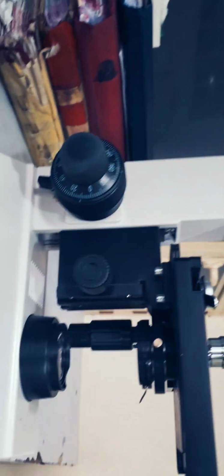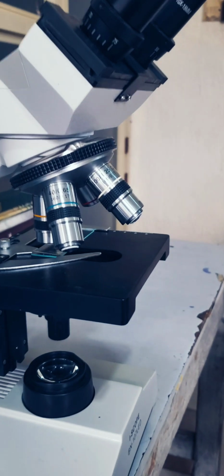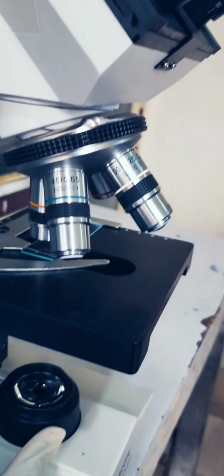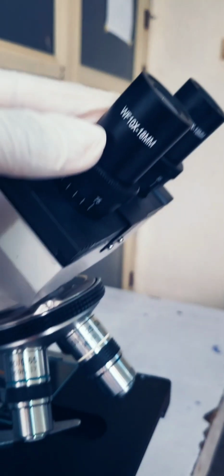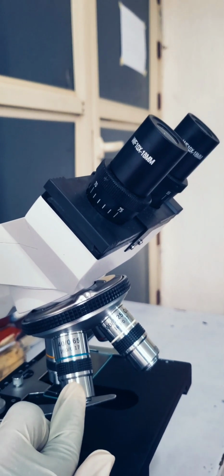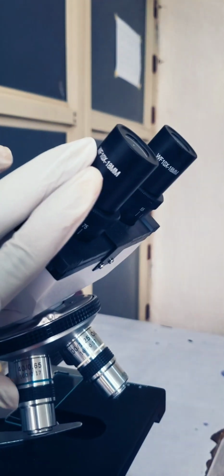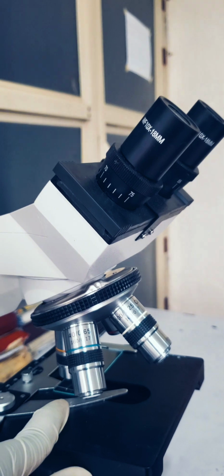Now to the principles of the microscope. Basically, when you put an organism on a slide and you put on the microscope, the light passes from the light source through the condenser and hits the organism, and you are able to see it on the ocular lens. Now the ocular lens and the objective lens are closely associated, because both lenses give you the magnification of the specimen you are viewing.